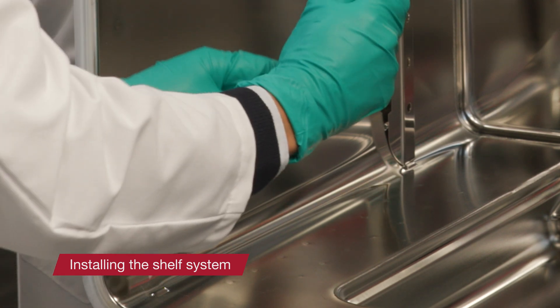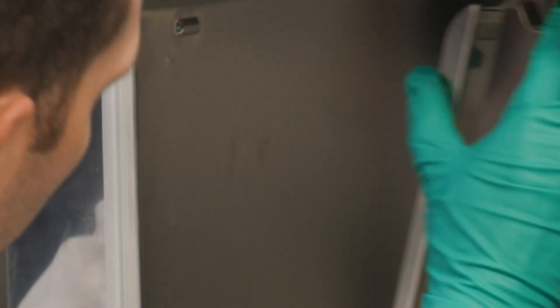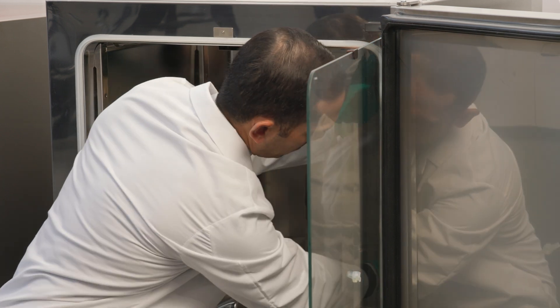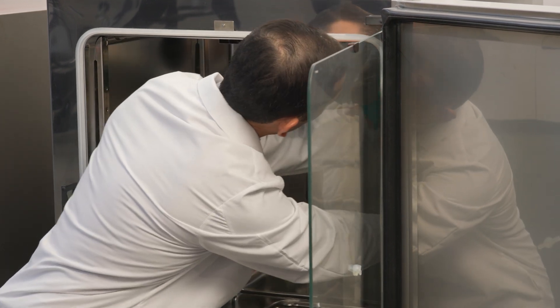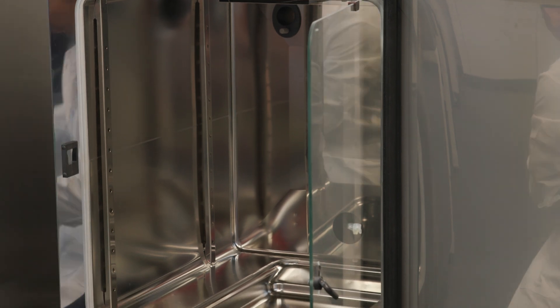The support rails are guided and held in place by the embossings. The lock springs of the support rails must point upwards. To get started, position the support rail onto the lower embossing and tilt it toward the workspace sidewall so that the rail is positioned over the two embossings. Then, clamp the lock spring behind the upper embossing.